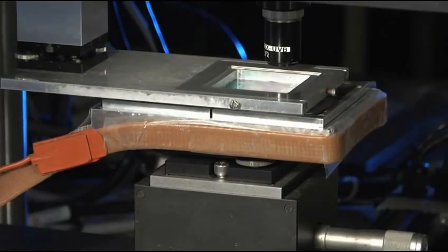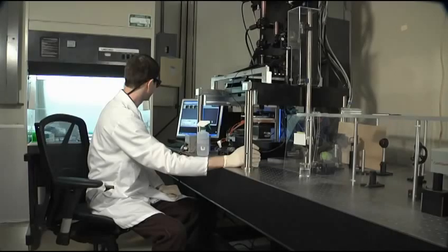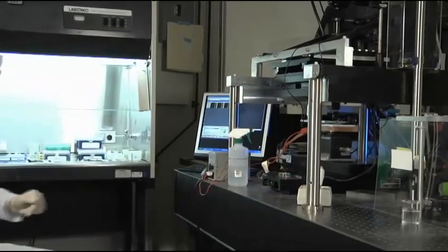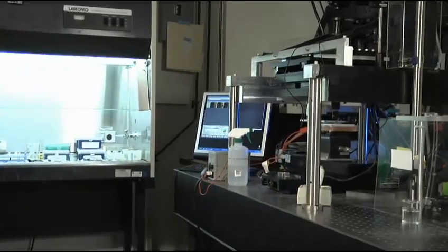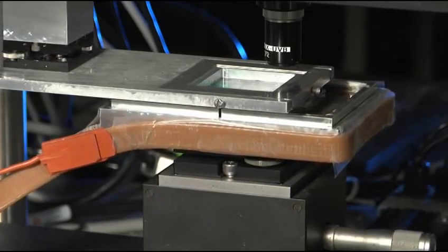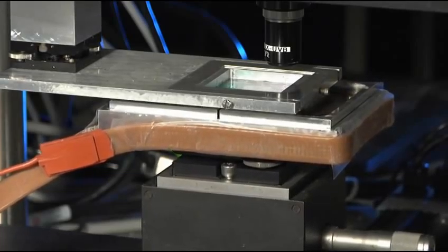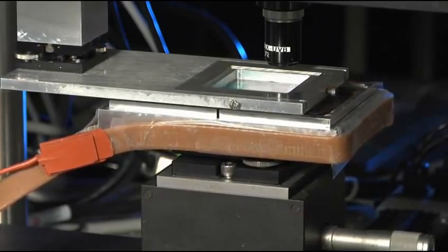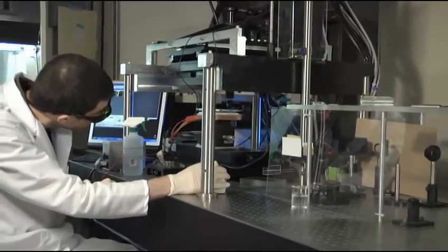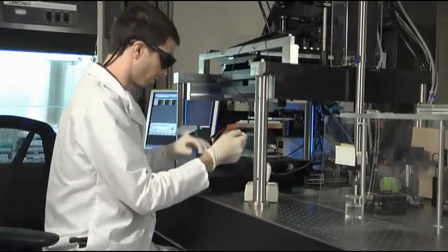And we make sure that we have ribbon to print from. That's it. So then just turn it towards the fine structure onto the paper.